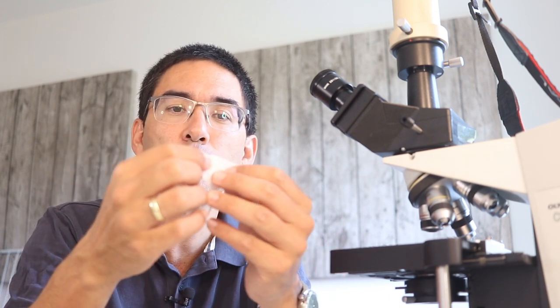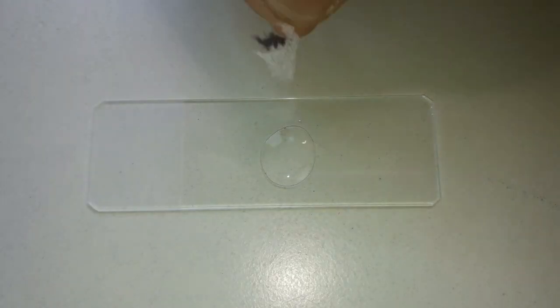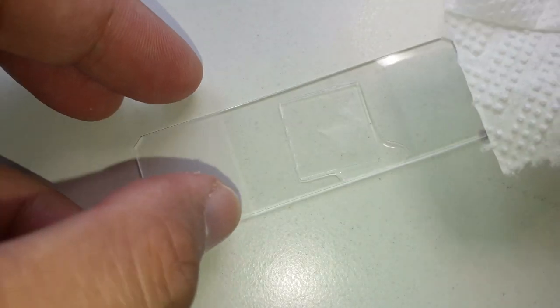If you don't have a specimen like that, I highly recommend making your own slide. Simply use some tissue paper, tear off a piece — don't use scissors, just tear it — because you want to see the fuzzy fibers under the microscope. Use a drop of water and put the cover glass on top. This works well as a first specimen.